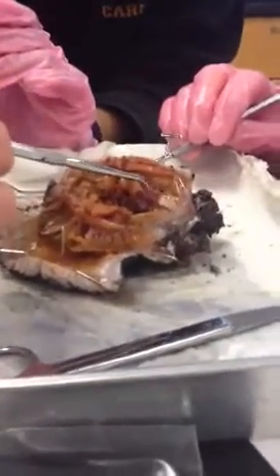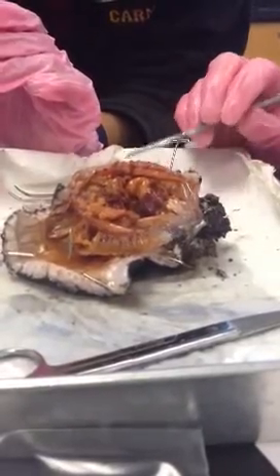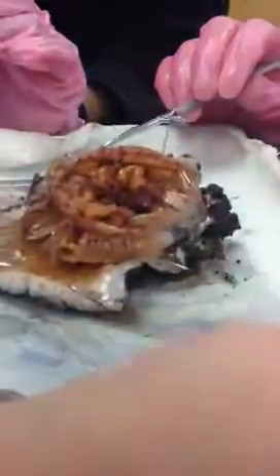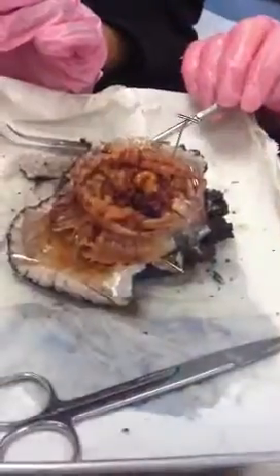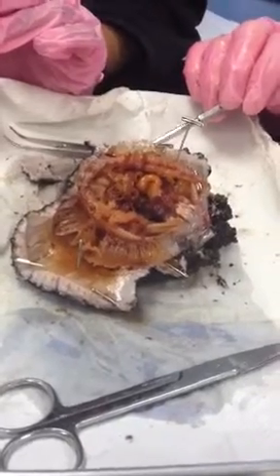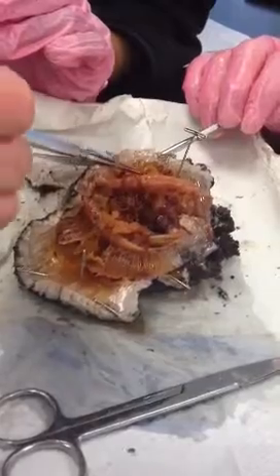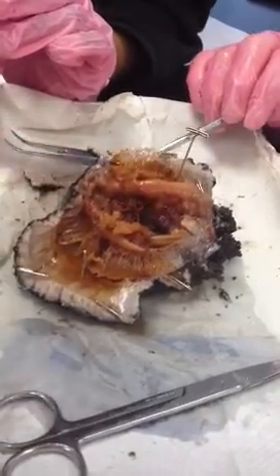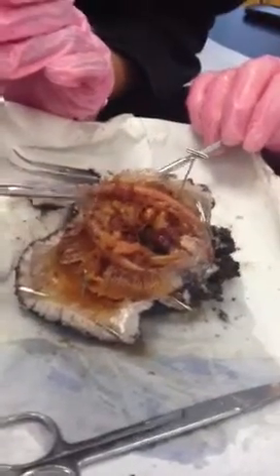And then from the pharynx, you see this tube? Yeah. Well, what does it have to be, just logically? Esophagus? Yeah. And so here you see the esophagus going down and eventually intestine. It's usually really hard to tell the stomach. So anything through this tube-like structure, like here, if you said intestine, that'd be good. Okay. Obviously, when it gets close to the end, intestine, and it'll be really obvious.